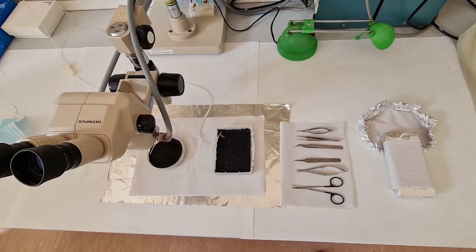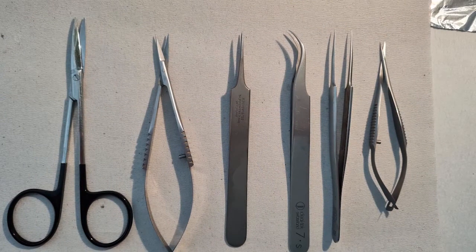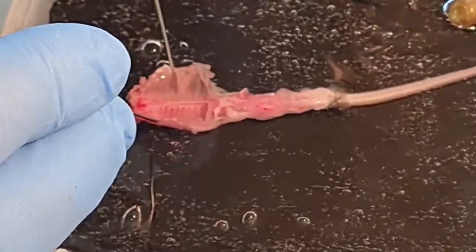Two chambers filled with ACSF, a larger one to accommodate the back part of the animal that contains the spinal cord and the vertebral column, and the smaller circular or more shallow container for the removed spinal cord. The surgical tools that you will need to do the dissection will be scissors, spring scissors, fine and coarse forceps, plus preferably a curved forceps.